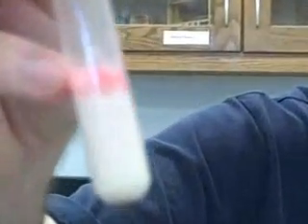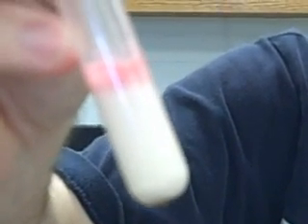Most interestingly, we added Sudan 4 to milk, shook it, and let it settle. The cream — the lipid layer — rose to the top, forming two separate layers. The lipid layer at the very top was stained red with Sudan 4. Some chemicals need time before the lipid layer separates out to the top, and it doesn't always happen with milk, but we were lucky it did.